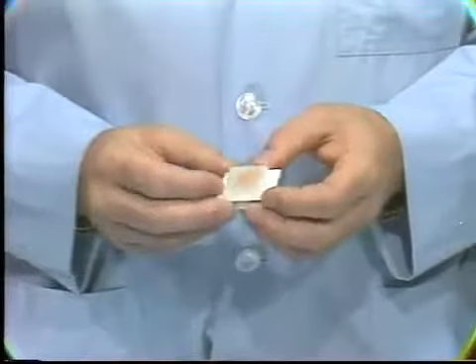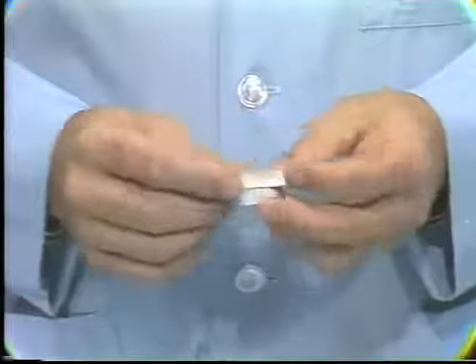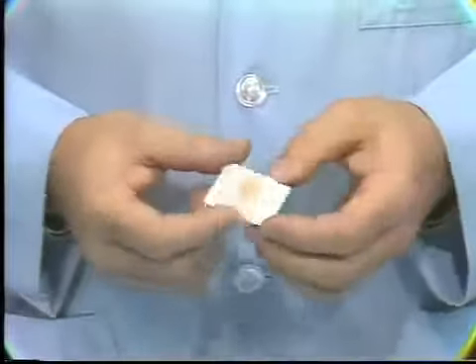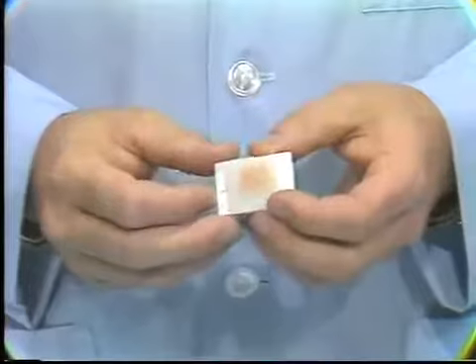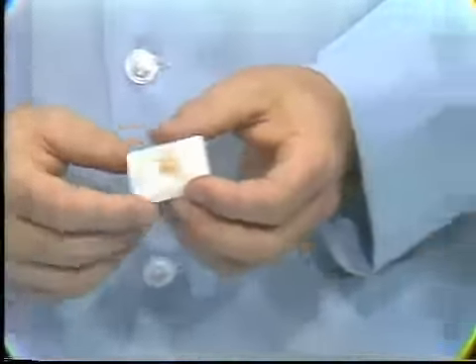See, the tissue is kind of light brown, embedded in paraffin, and then there's a white plastic container on the outside. This has been cooled, and you see it's solidified. We have the tissue then embedded in a solid media so that we can thin section it. I'm going to show you what the microtome looks like now.